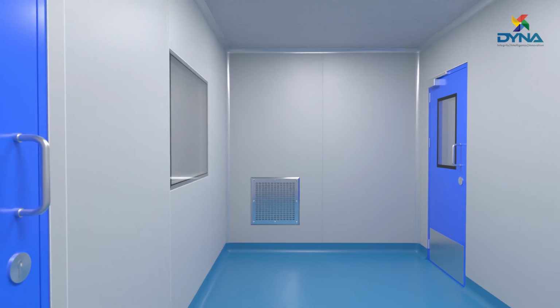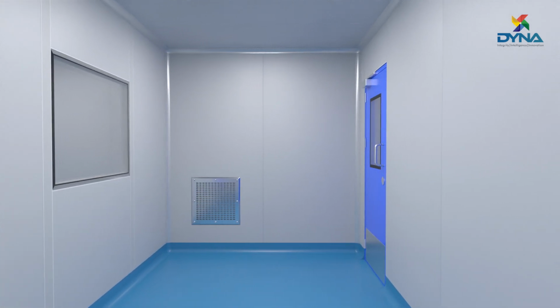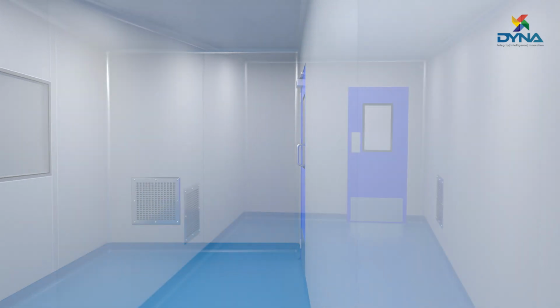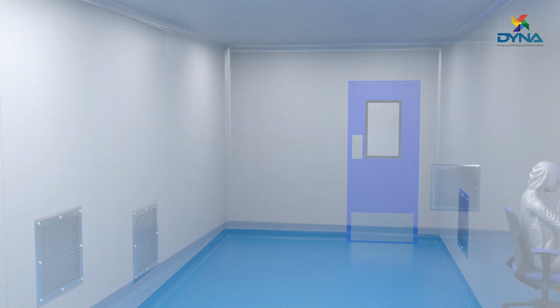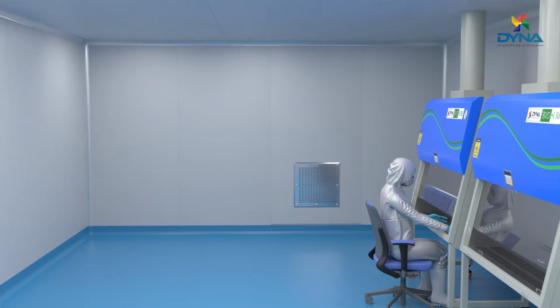Our pre-engineered modular cleanroom panel systems give a fast build and accurate installation, conforming to the latest good manufacturing practices where there is no edge or curve for dust to settle, thus maintaining the air quality that the cleanroom is designed to provide.